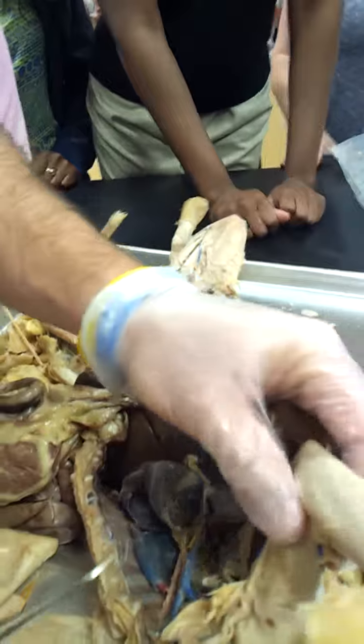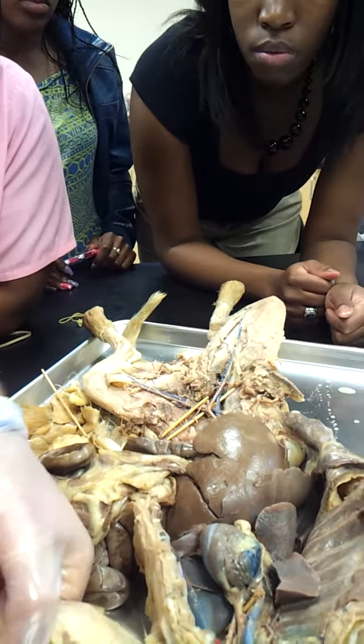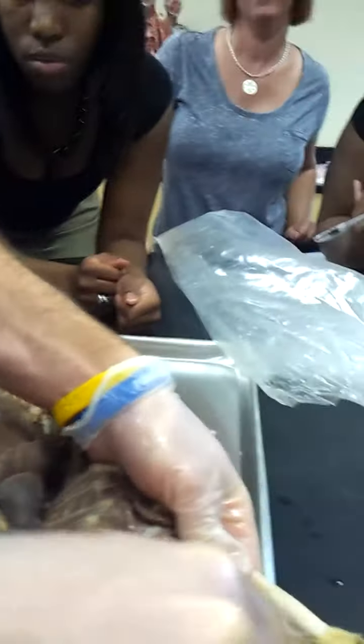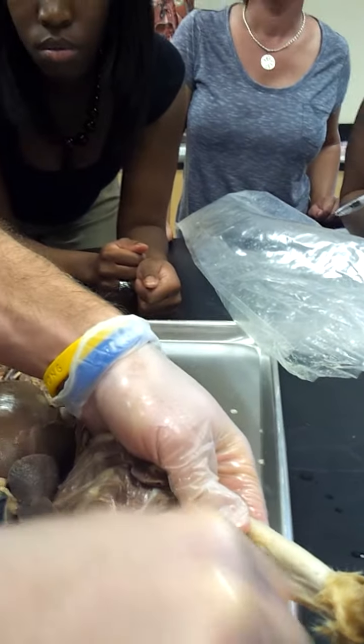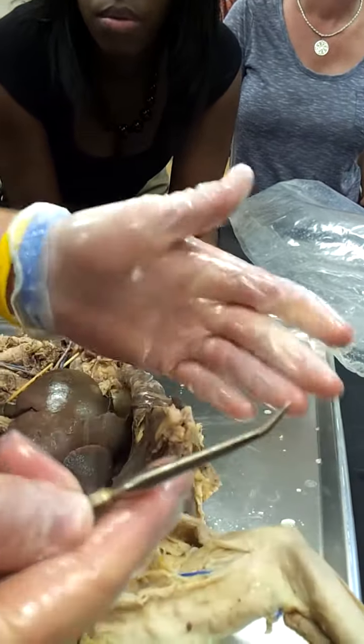Okay. If you do see something pinned in the arm, this cat didn't have it very well. I ended up cutting it up. But if there's a vein that runs along the radial portion of the arm, it would be the radial, and the ulnar side, ulnar.